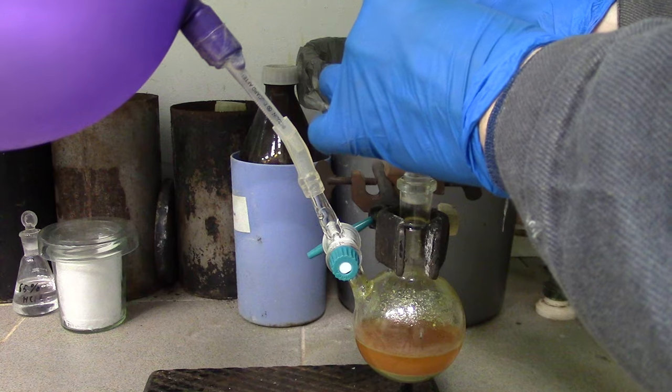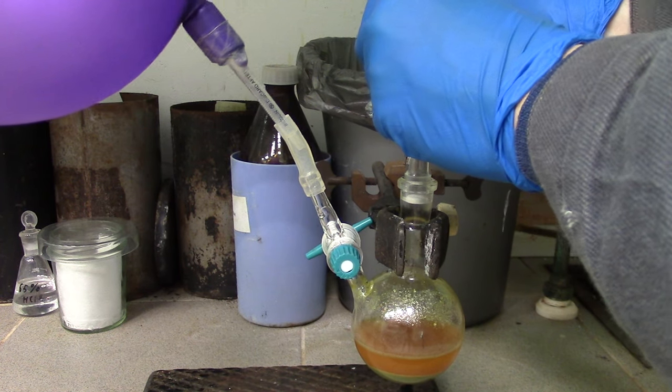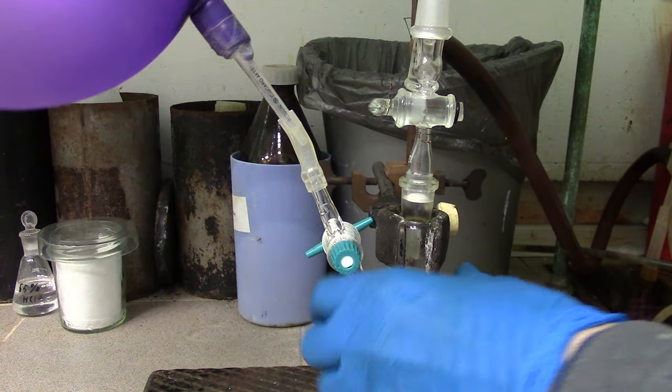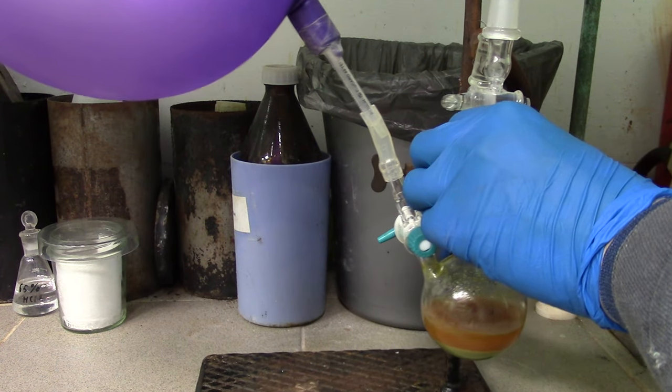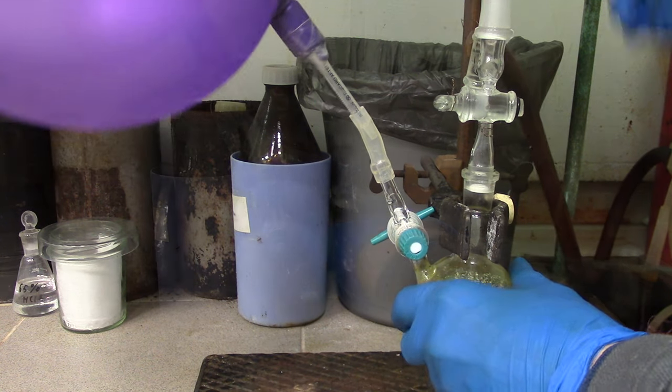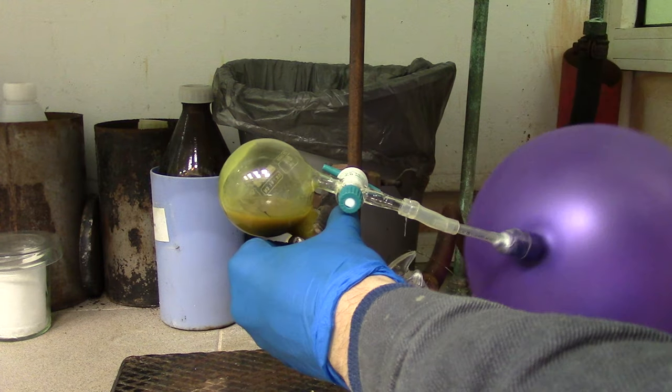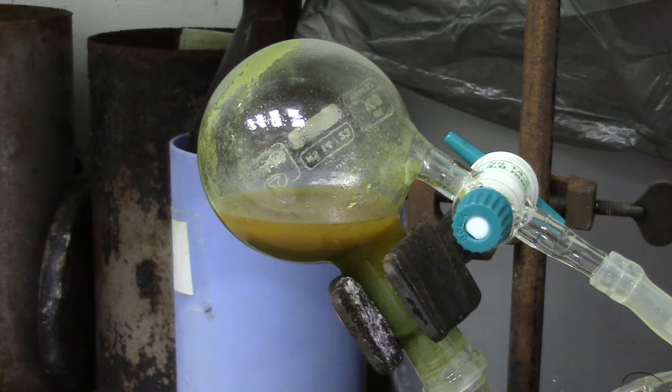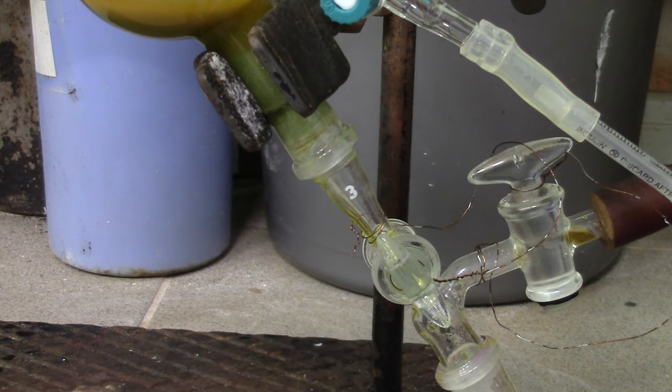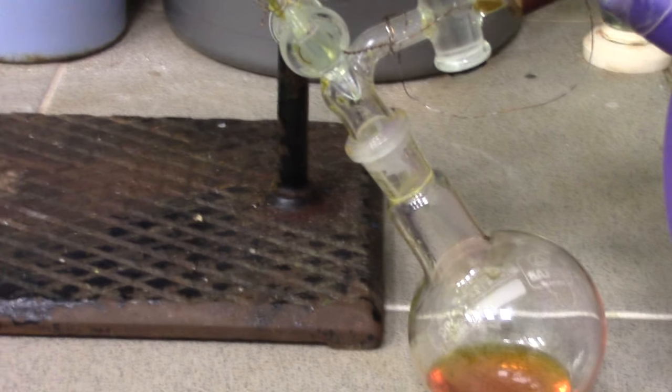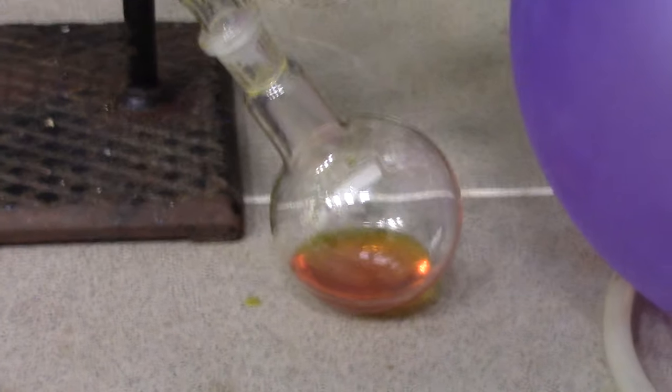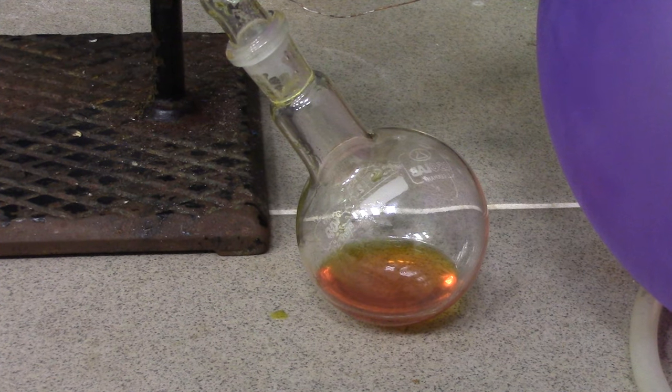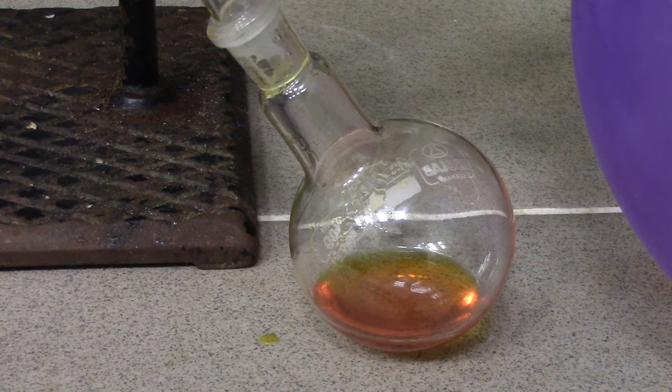Open the vacuum exit tab. Connect a pump hose. Then turn the whole construction upside down, shaking well the reaction mixture in the main flask. Now open an argon flow and the middle tab. Nice. As you can see, DMSO with impurity starts to move out the Schlenk flask.